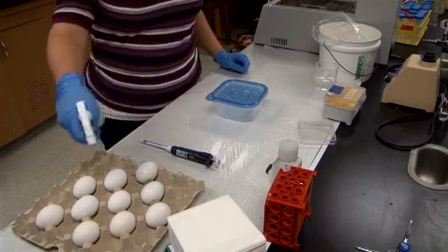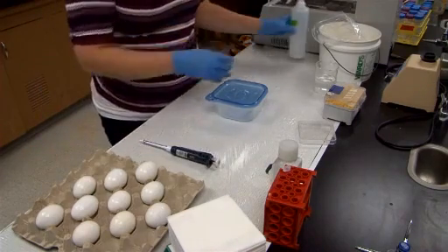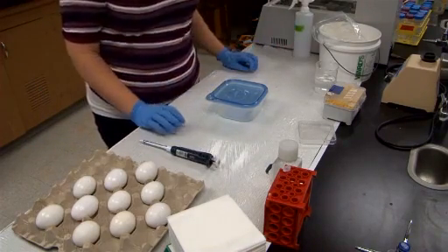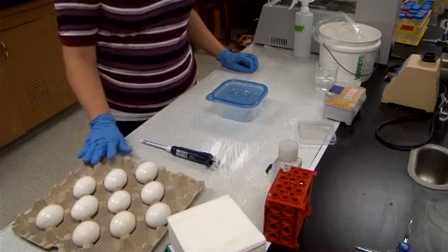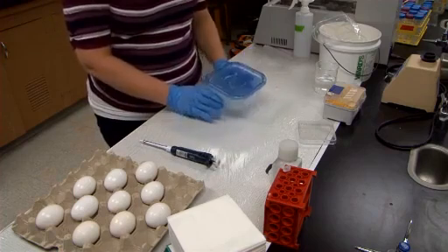The eggs are prepared by spraying them with 70% ethanol so that when the shell is cracked, the embryo is not contaminated. After the eggs have been sprayed, they are left momentarily to dry while the humidity chamber is prepped.